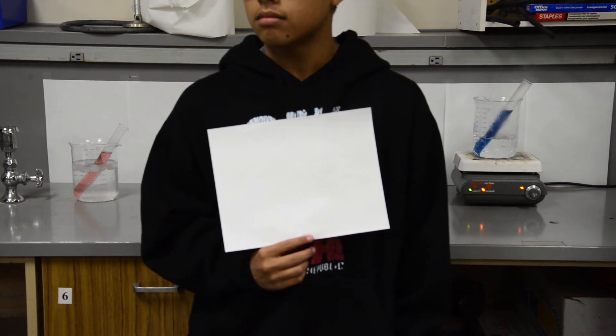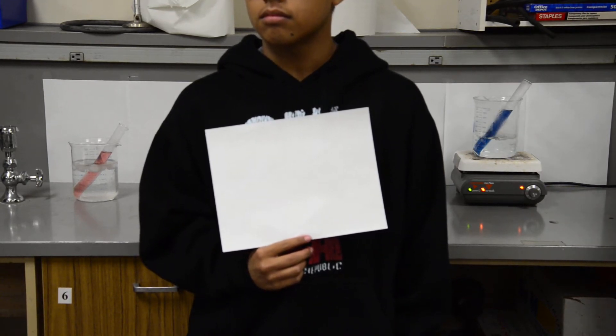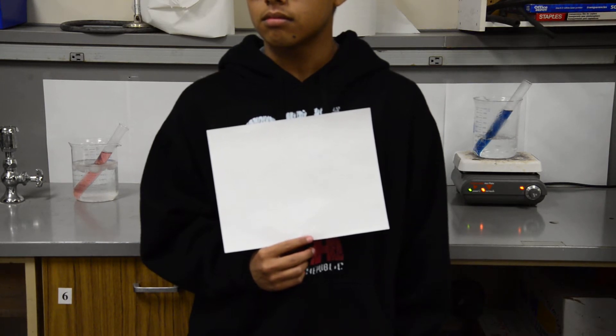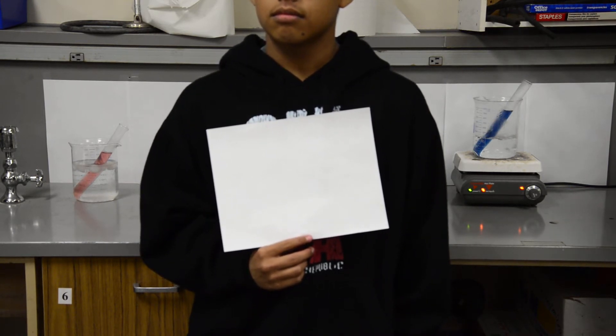What you're about to see is an equilibrium demonstration for Le Chatelier type problems. This particular one involves cobalt chloride.